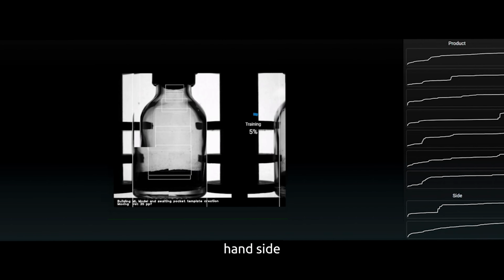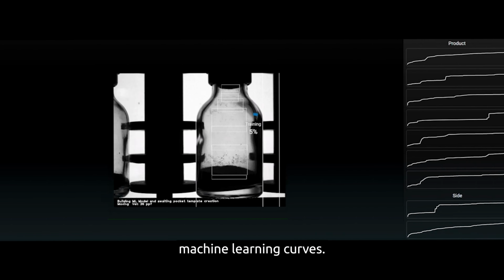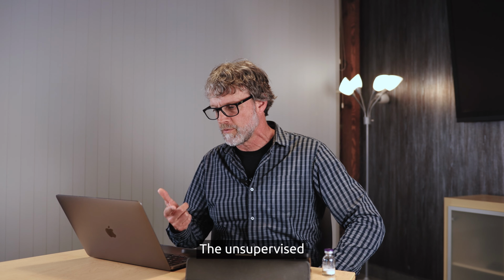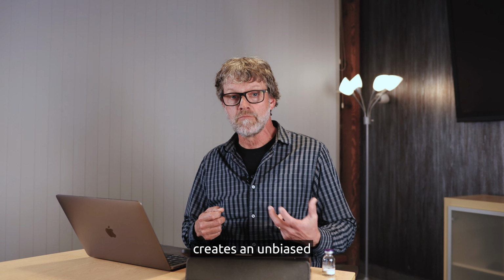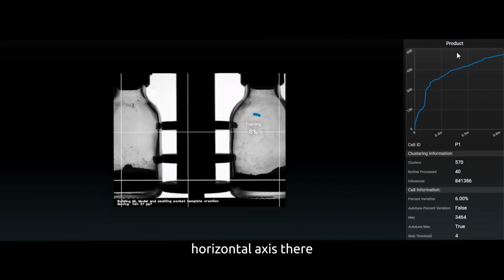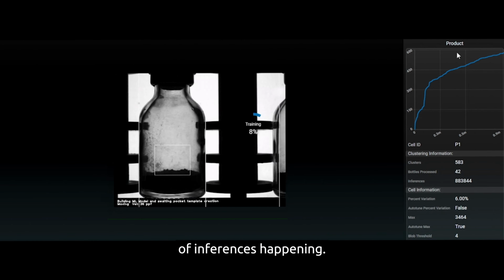Over on the right-hand side, you see what are called machine learning curves. This is the unique feature of Avis. The unsupervised machine learning creates an unbiased model of normal variation, and along the horizontal axis you can see there are millions and millions of inferences happening.